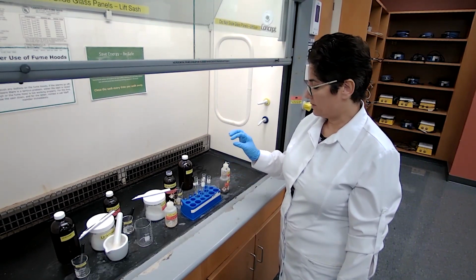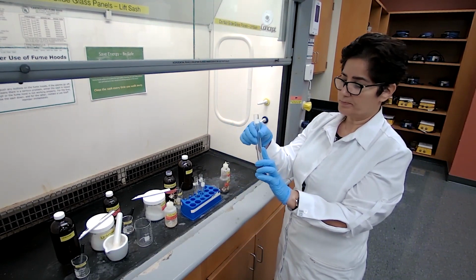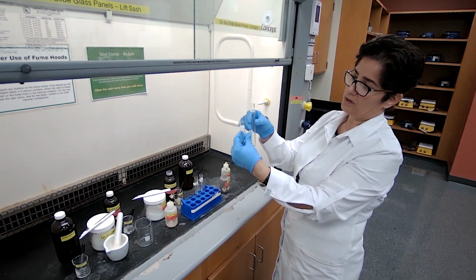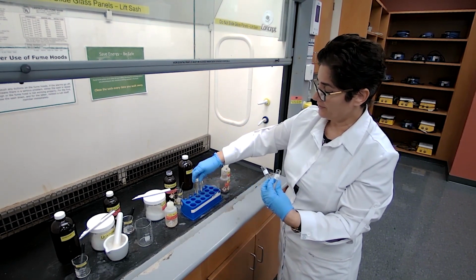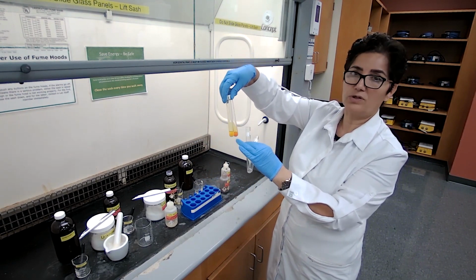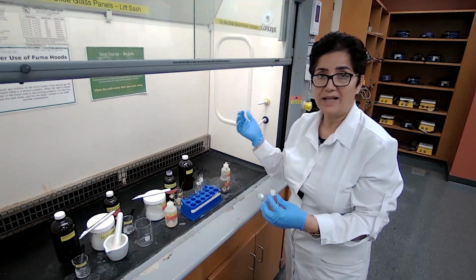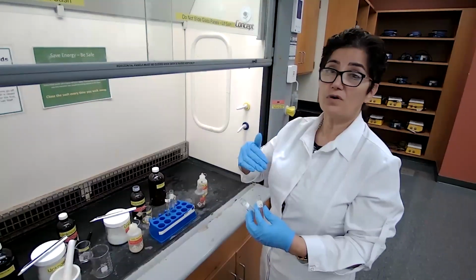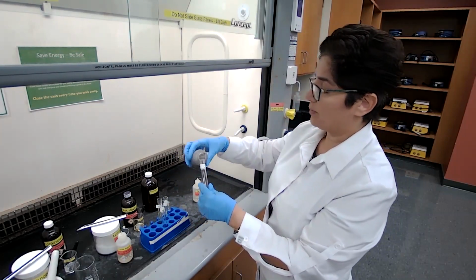We are going to make the Tollens' reagent first. I'm going to make it in one test tube, and then divide it in half, so I can use it for both unknown 5 and unknown 6. These are the unknowns that previously showed they're either an aldehyde or a ketone. We don't want to do the Tollens' test on unknowns that we don't know are aldehydes or ketones. So 2,4-dinitro should always come before the Tollens reagent.